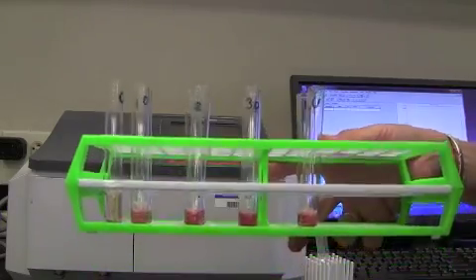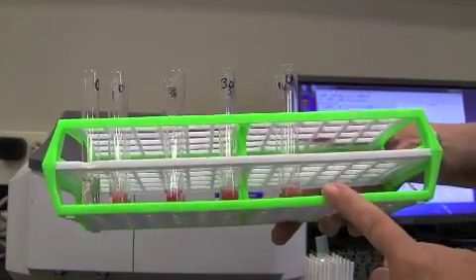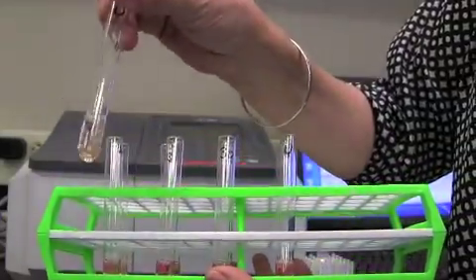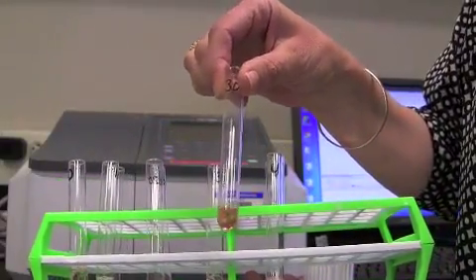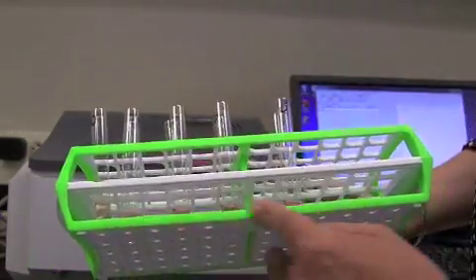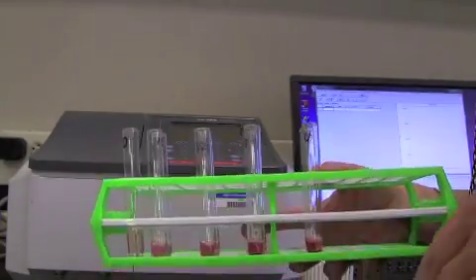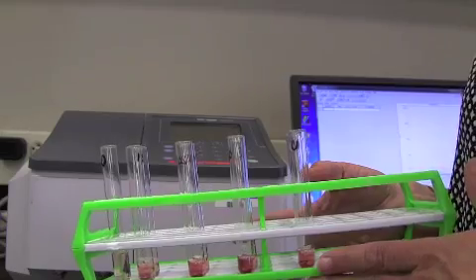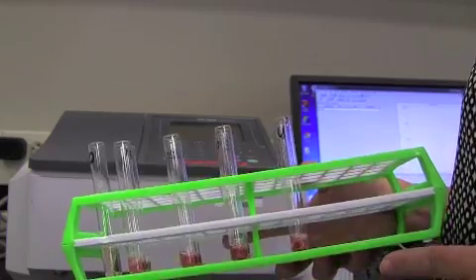So the amount of colour that you get, the more cholesterol that you add to the assay, the stronger the colour you're going to get. So you can kind of see this, that if you look at the 0, it's pretty pale. You look at the 30 milligram percent, it's really quite a strong pink colour. Now, because the amount of pink colour is proportional to how much cholesterol we added, if we can figure out how much colour we have, that is by measuring the absorbance of our samples, then we can relate that to how much cholesterol was added in the first place.